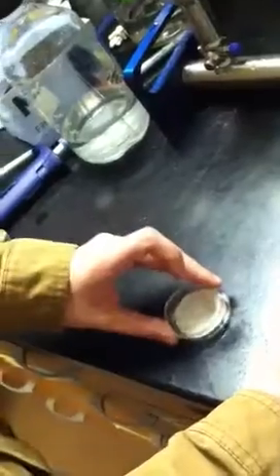Before we take it off, get a petri dish — these are all sterile, you don't want to touch the insides. This is just a pad. You take this and now you would get your medium from the refrigerator — the blue things — and squeeze it on the pad. Then, once you have the pad, you take your filter paper and sit it on top of it. Carefully close it, right on top.